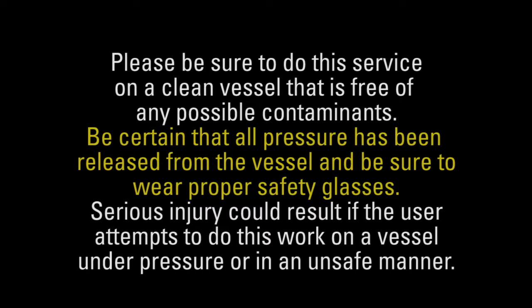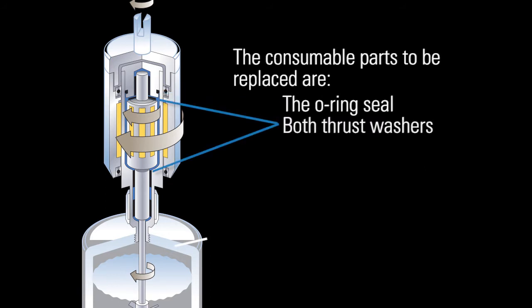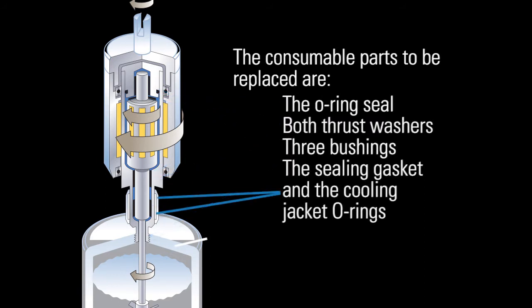Please be sure to do this service on a clean vessel that is free of any possible contaminants. Be certain that all pressure has been released from the vessel, and be sure to wear proper safety glasses. Serious injury could result if the user attempts to do this work on a vessel under pressure or in an unsafe manner. The consumable parts to be replaced are the O-ring seal, both thrust washers, 3 bushings, the sealing gasket, and the cooling jacket O-rings.